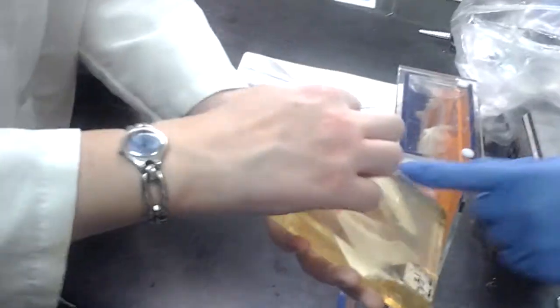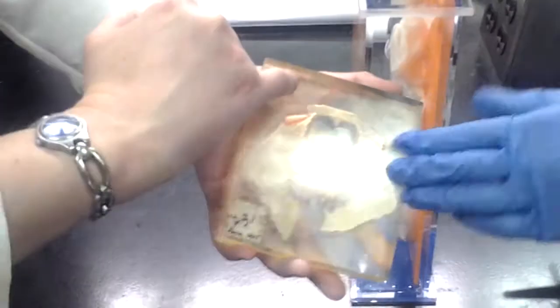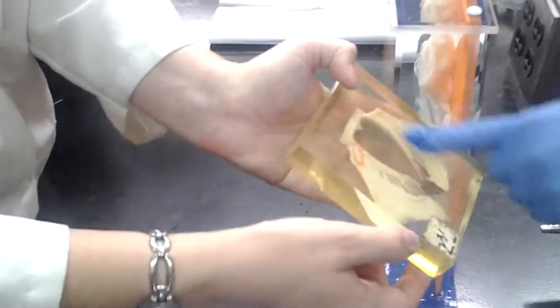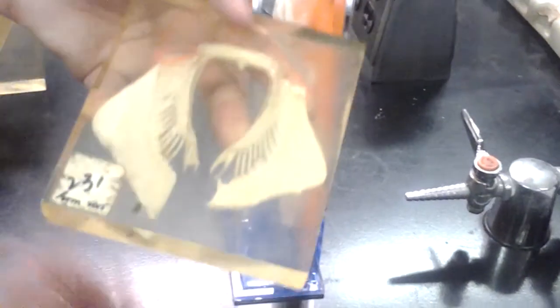These little bumps are ceratotrichia. Wait, which one is the ilium? The iliac processes are here. This is the ceratotrichia here, the outermost part. What are the feathers? Those are radials. In the pelvic fin, radials go out like the spokes on a bicycle. Ceratotrichia are the outermost part, forming most of the fin.